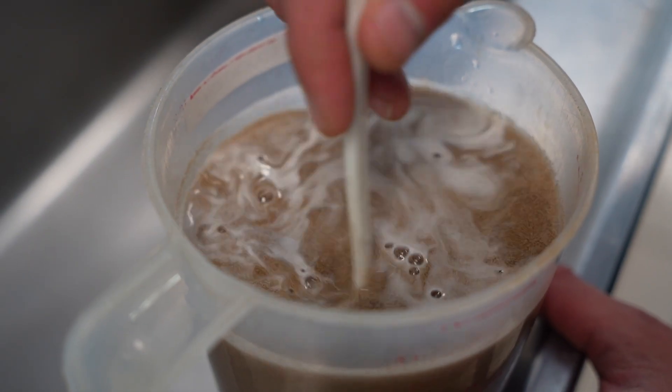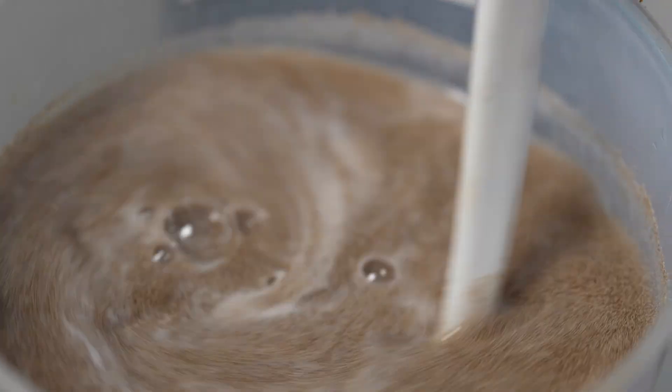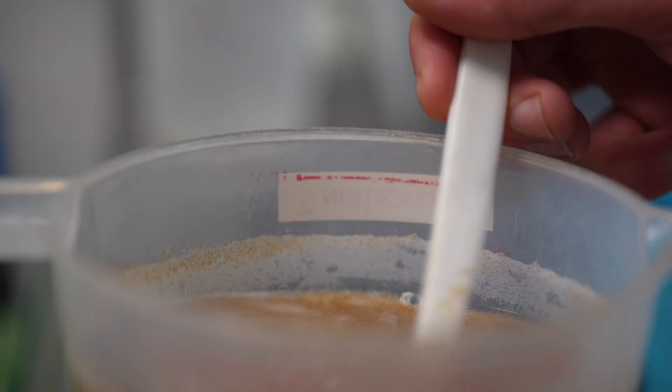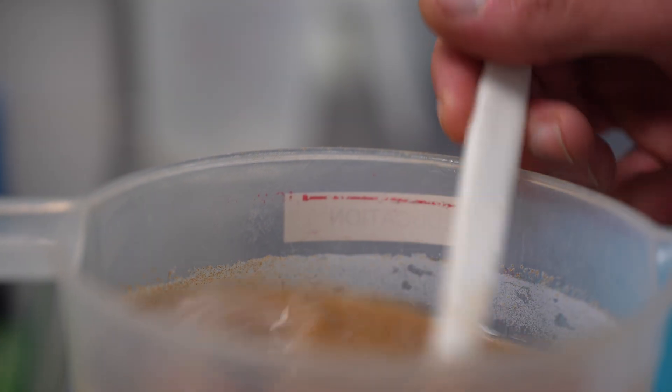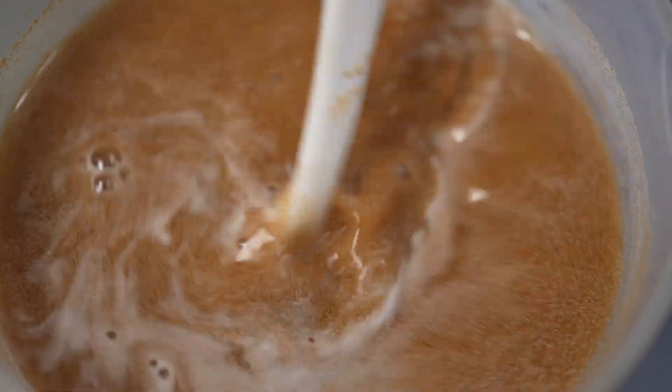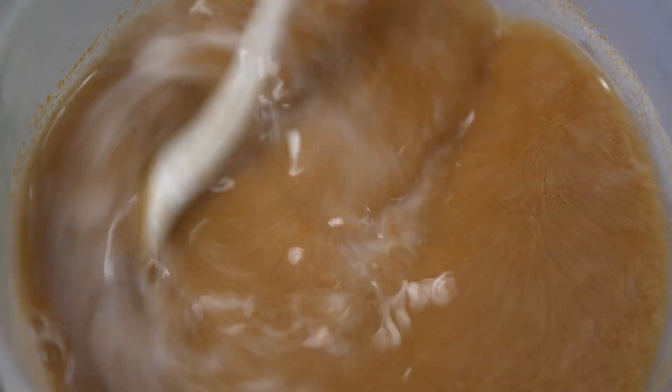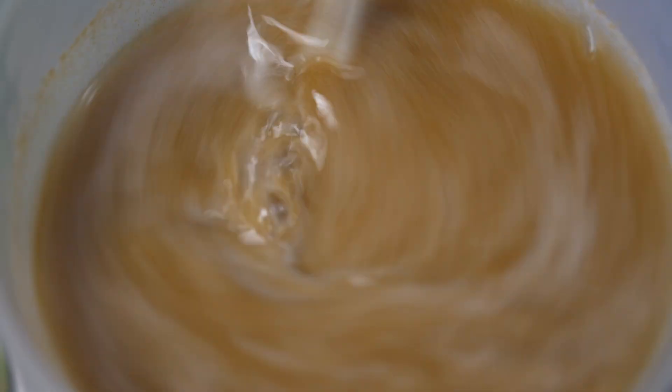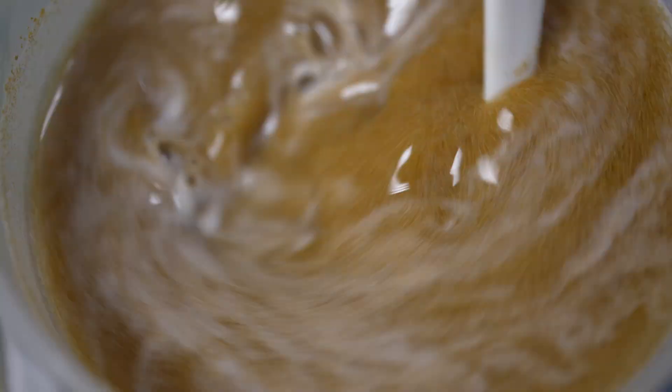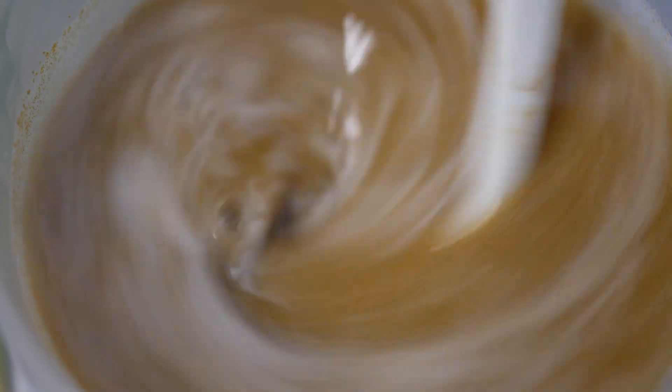They are entirely safe here. You just have to be careful with how long you stir them for. If you do it for too long and the cyst breaks away and then you keep them in the bleach, then obviously it'll start reacting with the artemia themselves. So you just have to keep an eye on it and then judge when it's ready and then get rid of the bleach.